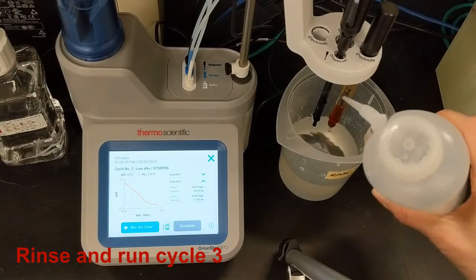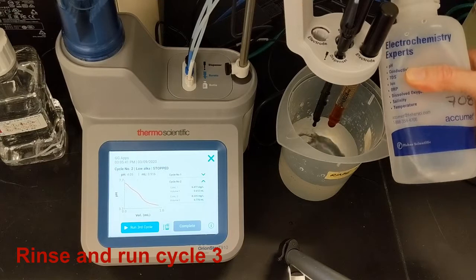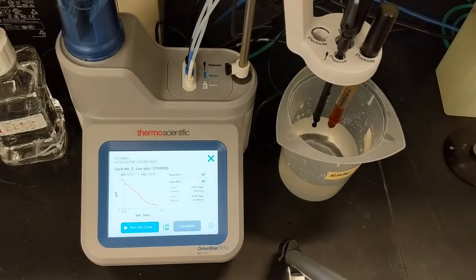I rinse thoroughly between the titrations, as always. This is important for the accuracy and repeatability of my titrations.